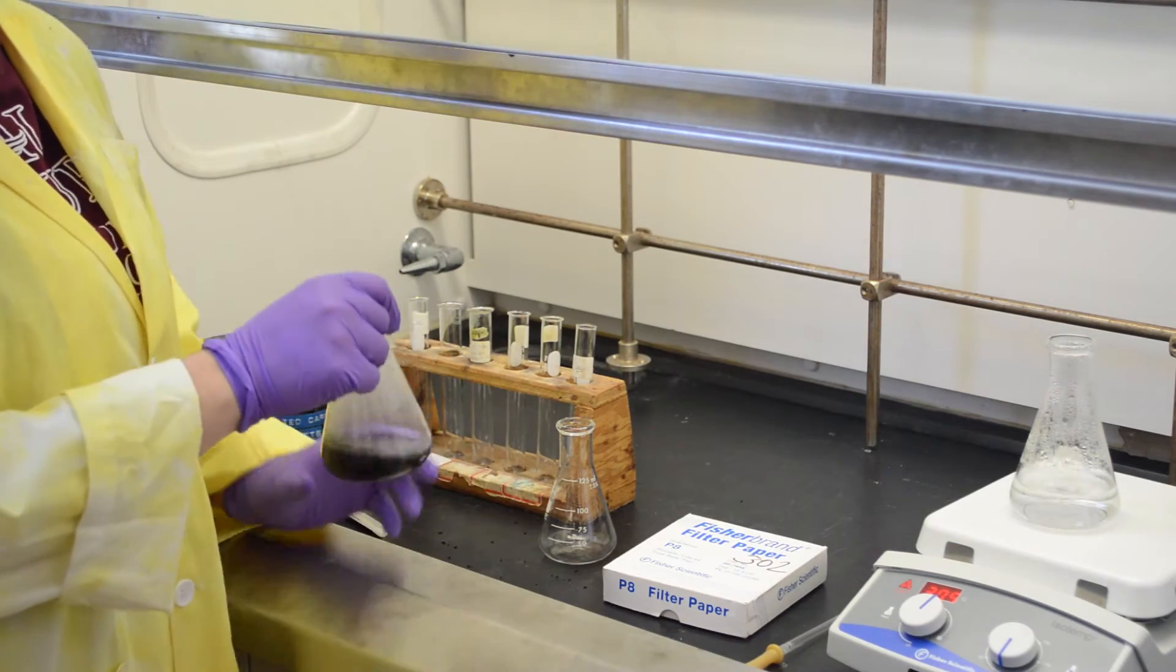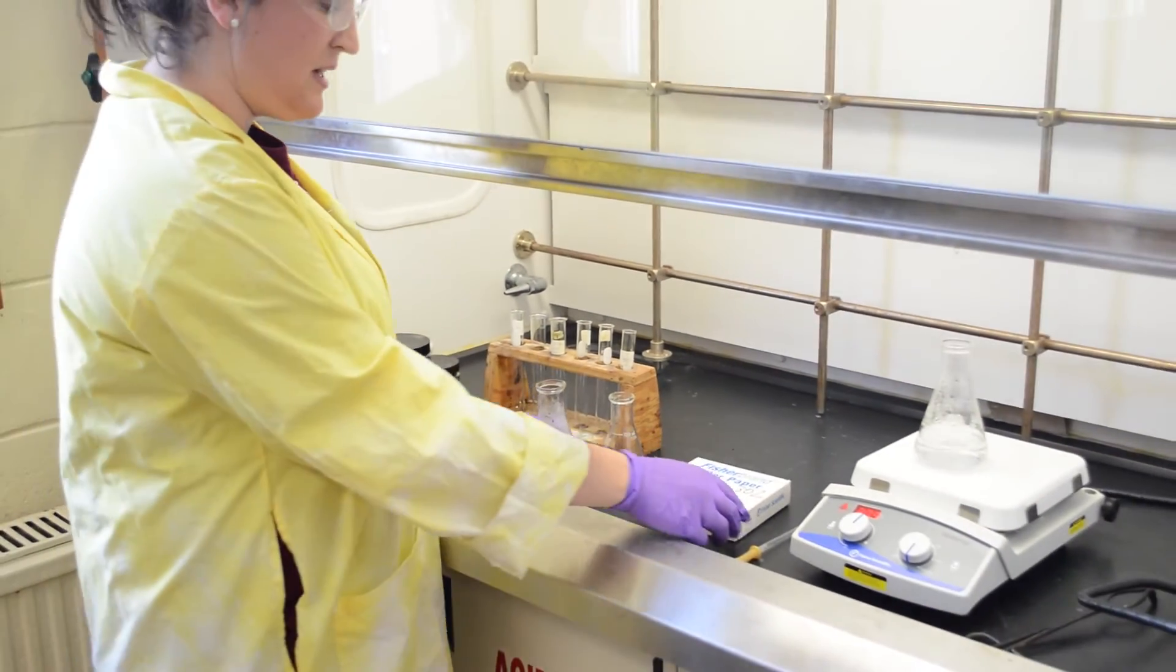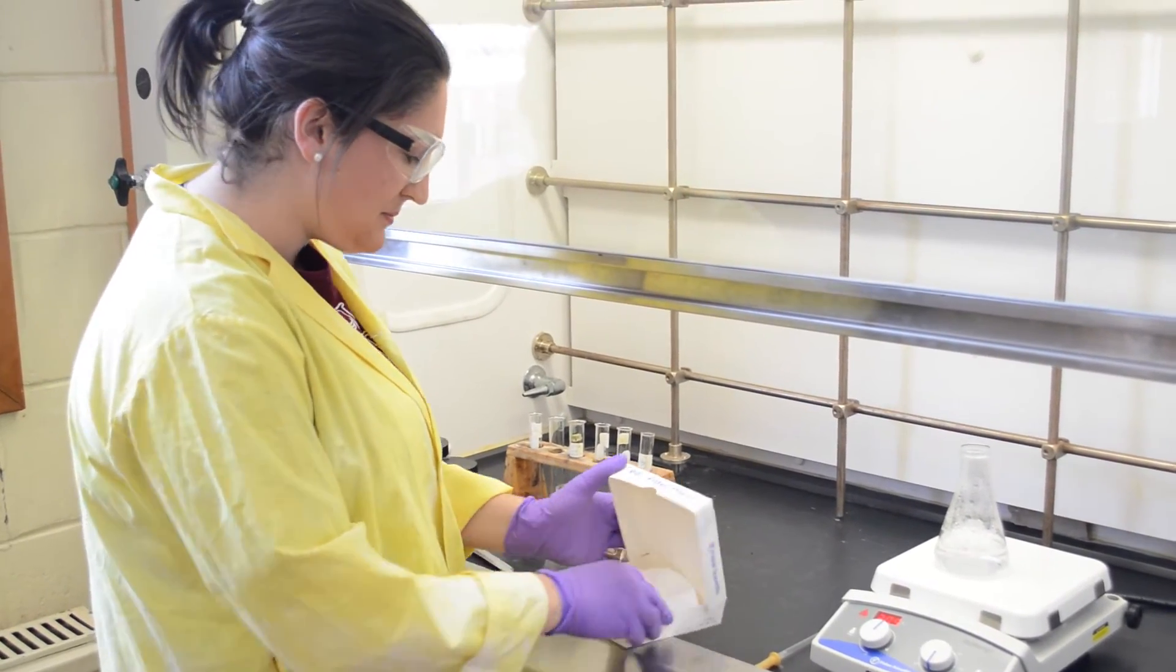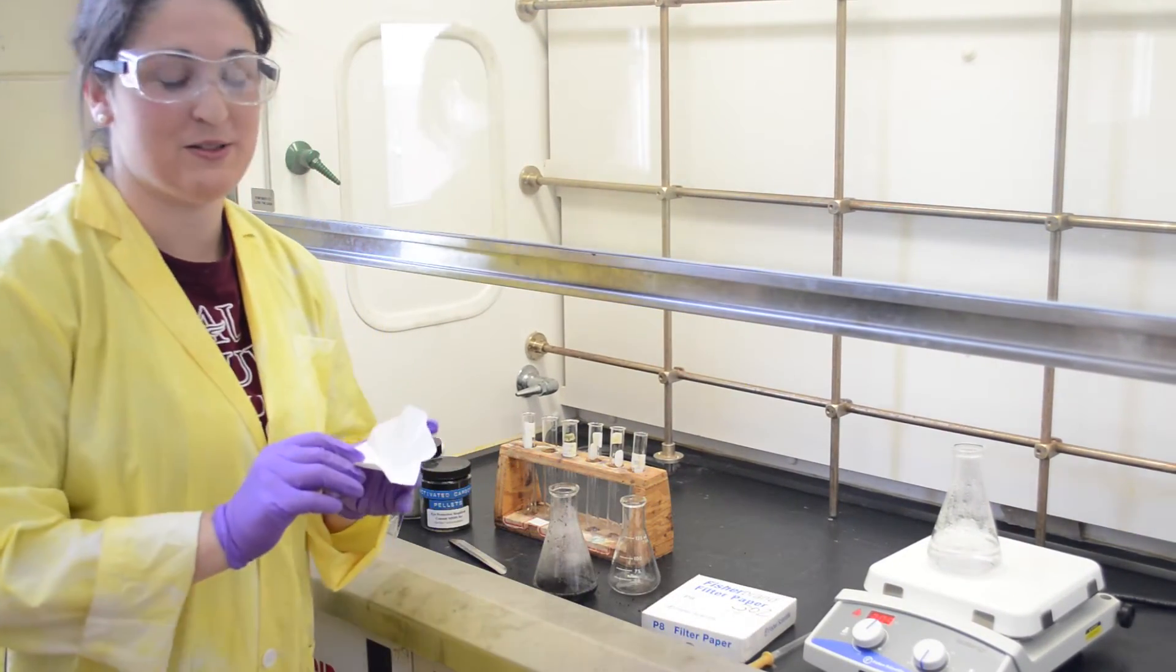Once you get a nice clear solution, you want to hot-filtrate it. To do this, get a nice big filter paper and fold it into a funnel.